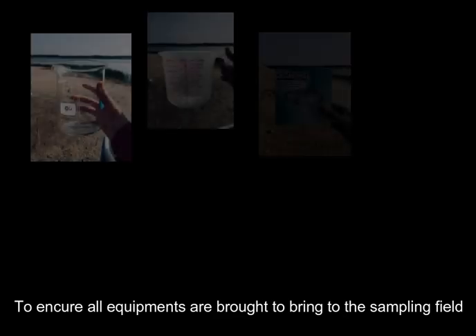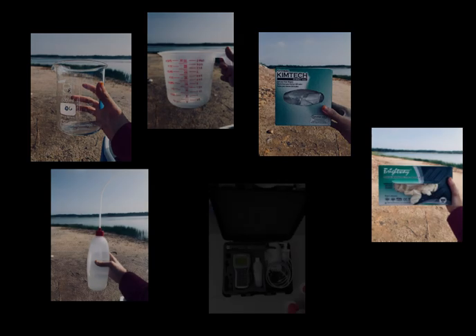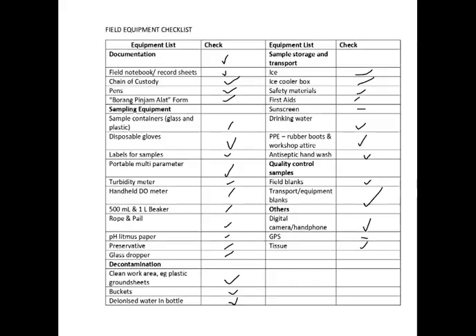Before going to the sampling field, every equipment needed for surface water sampling was organized in a field equipment checklist. This is to ensure completeness in carrying out the on-site test.